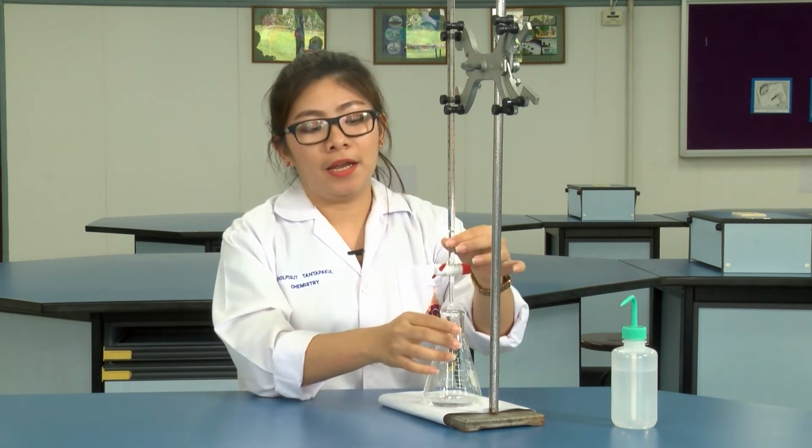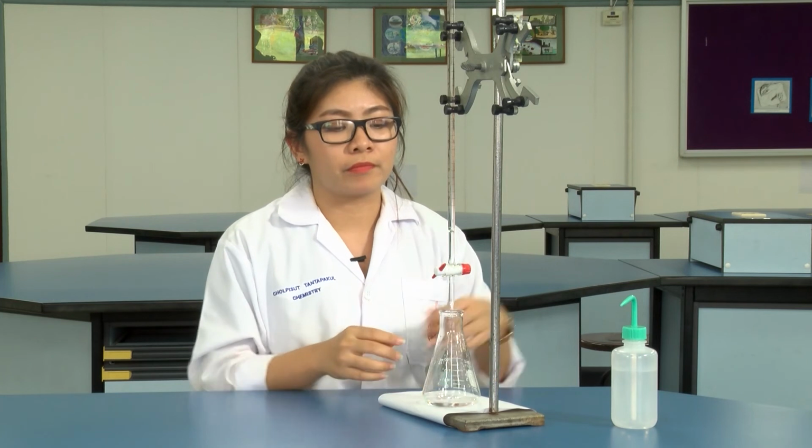After you titrate for a while, the solution will show the color of the indicator as a light pink, and you will observe that the pink of the indicator disappears more slowly, so you need just a half drop of the standard solution.